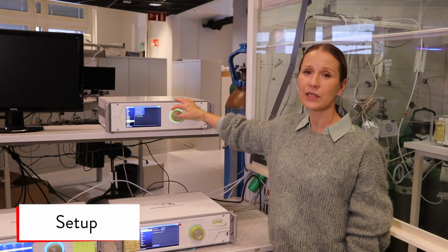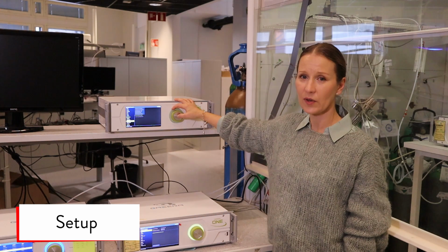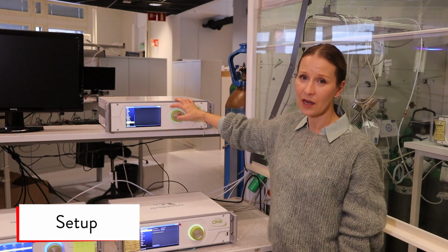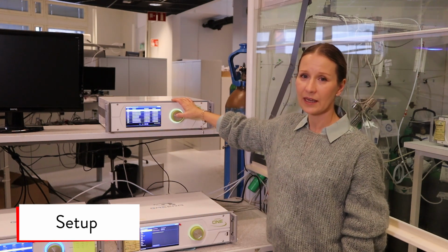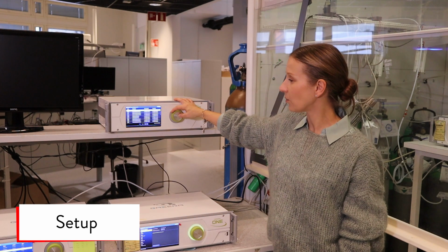Only in the diagnostic situations, if you want to find out what's the problem with the device, then the debug logs is enabled. Then the active errors. Now there's no active errors. And on the error log, you can see all the errors or messages that the device has encountered.